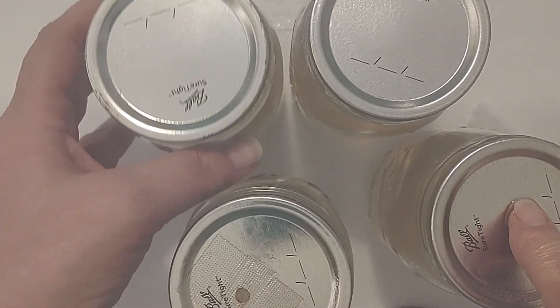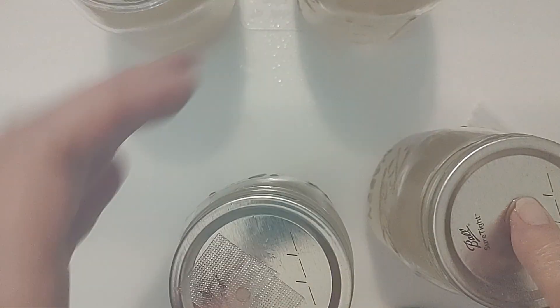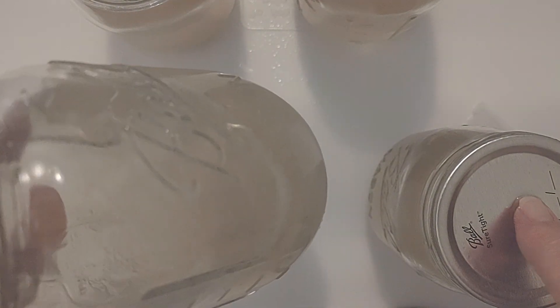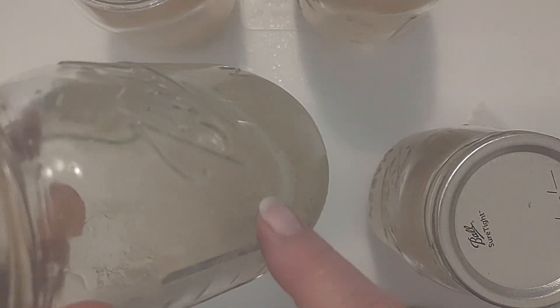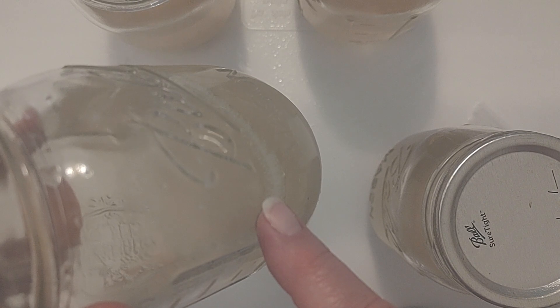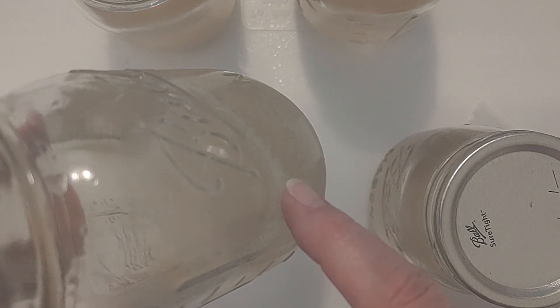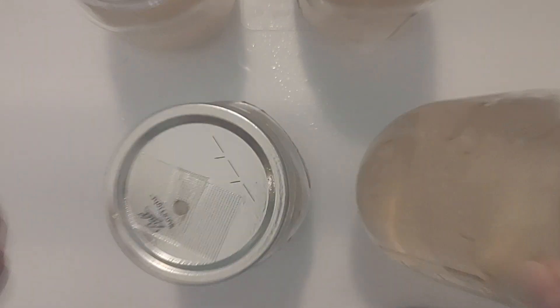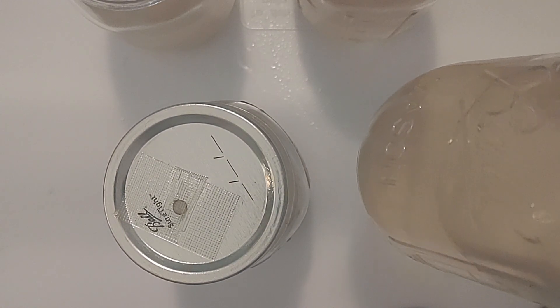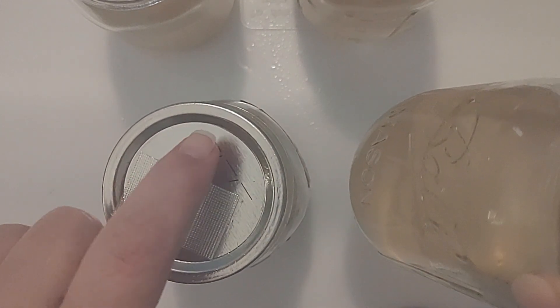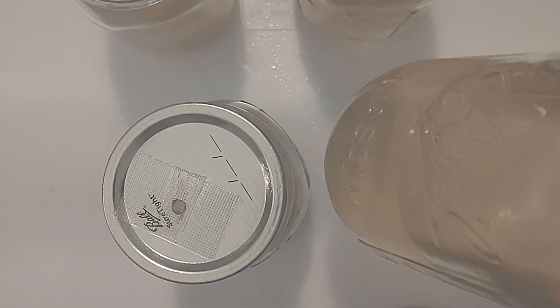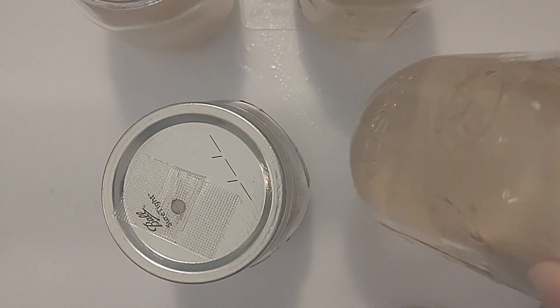So we had a slurry that just didn't break up and I did a video on that for you, and the mycelium here is gorgeous. So what we're going to do is take a syringe here and put it into this liquid culture and turn the slurry into a liquid culture since the slurry never broke up.